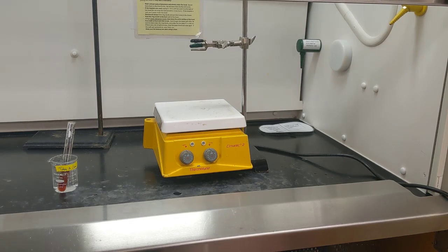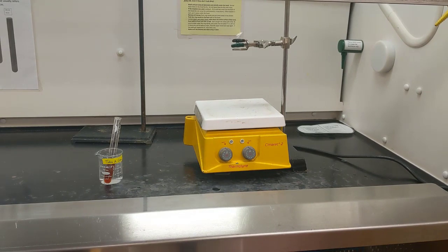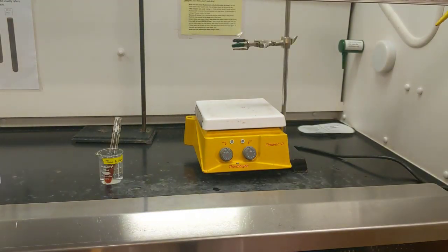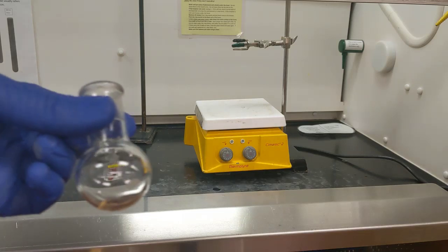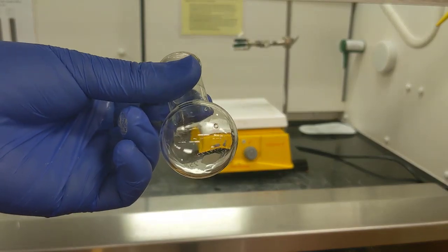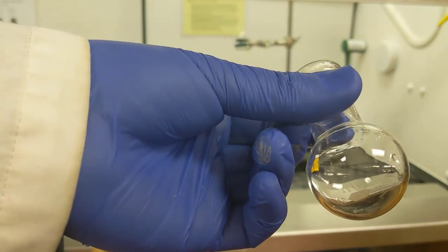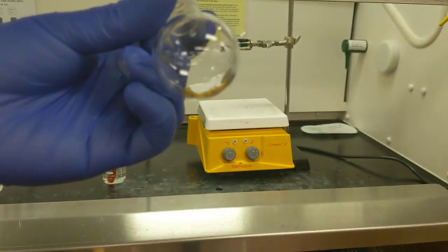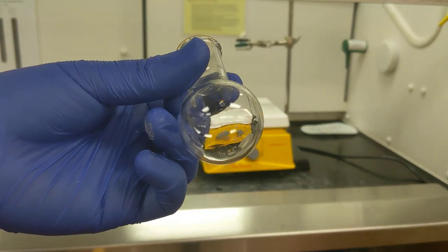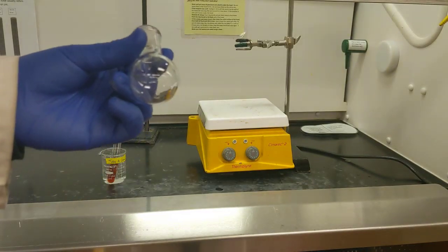While I'm waiting for that precipitation reaction to occur, one thing I can do is prepare my round bottom flask for the next step. I got a beaker of ice water, and then from my organic chemistry kit, I got my 25 milliliter round bottom flask. What I want to do next is add 0.38 grams of 2-naphthol to this round bottom flask, followed by 2 milliliters of 2.5 molar sodium hydroxide. So let's go ahead and measure out the next reagents on the scale and then add them to this round bottom flask.